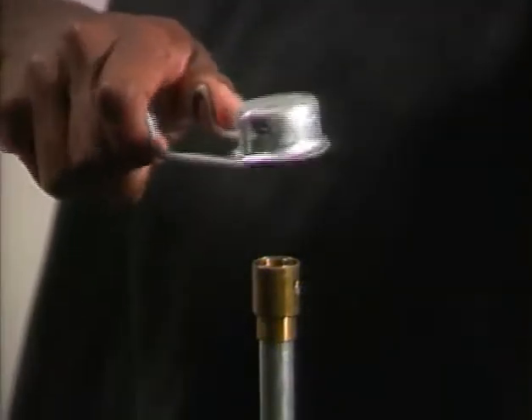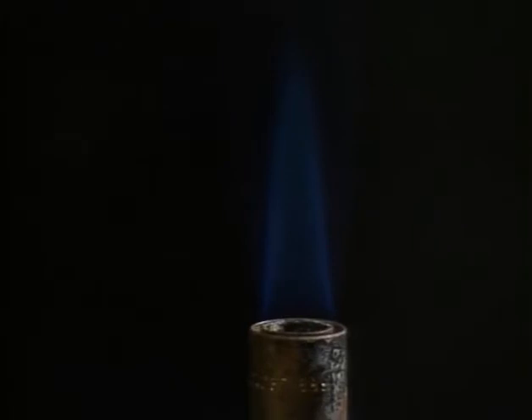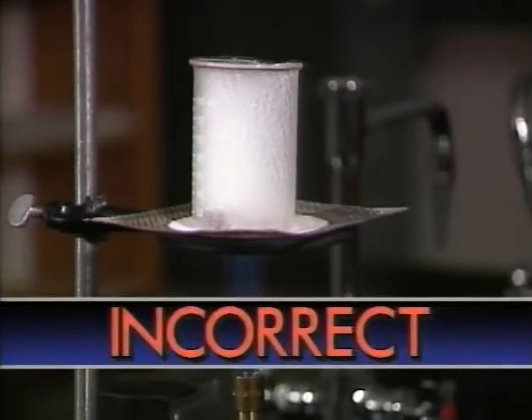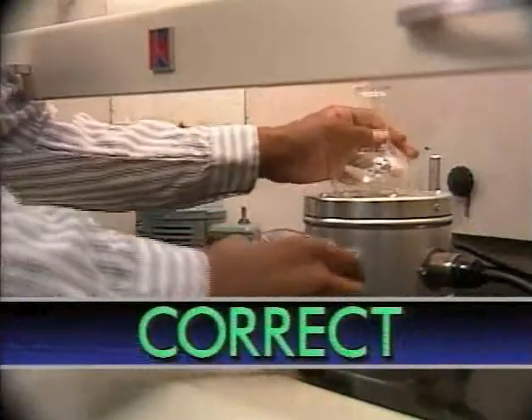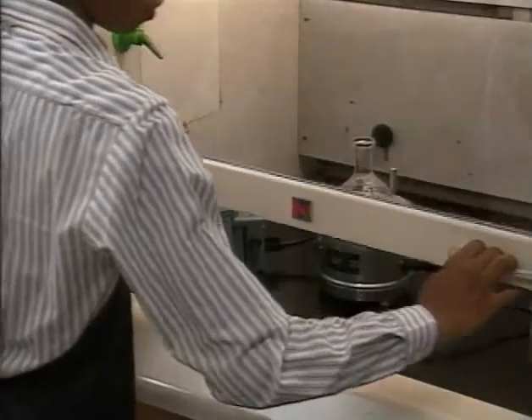The main heat source in most chemistry labs is the Bunsen burner — it produces an open gas flame burning at a high temperature, and there's always the danger of an accident if it's not used properly. For example, it should never be used to heat volatile organic liquids that give off flammable vapors. Those substances should be heated in a heating mantle or steam bath in a hood. For most other substances, a Bunsen burner is an ideal heat source when used properly.